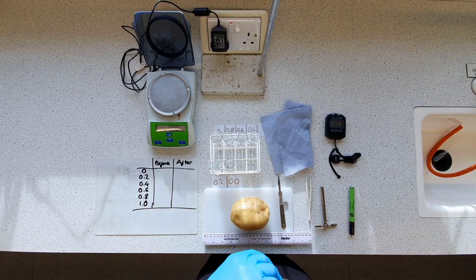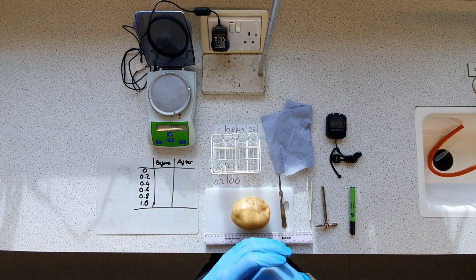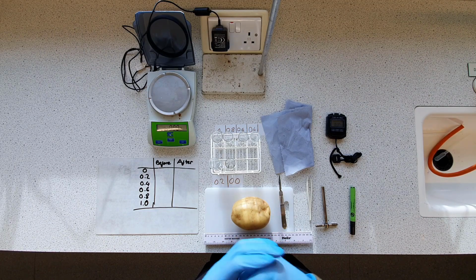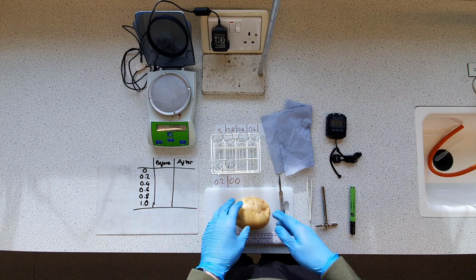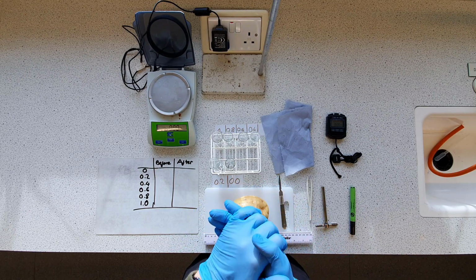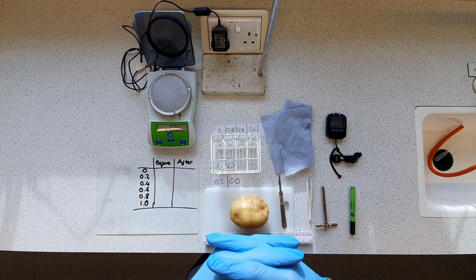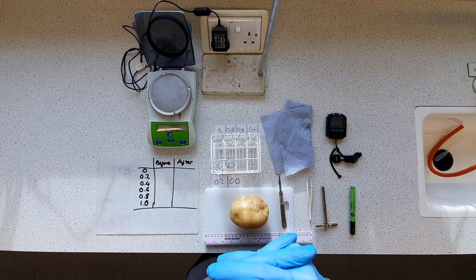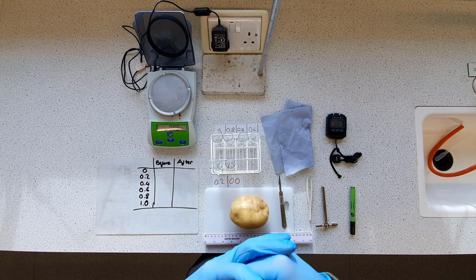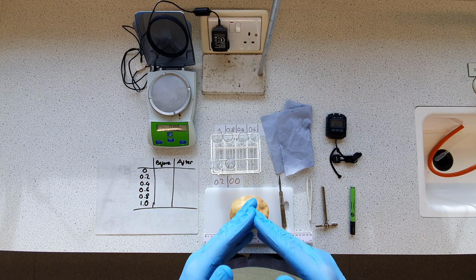Alright everybody, so today I'm going to be taking you through a truncated version of Required Practical 3, which is an investigation into osmosis in potato tissue. The principle upon which this is based is the idea that when you have two differential areas separated by a semi-permeable membrane, water will travel through the membrane from an area of higher water concentration or water potential to a lower area. So it's a type of diffusion, but specific to water and with a semi-permeable membrane.